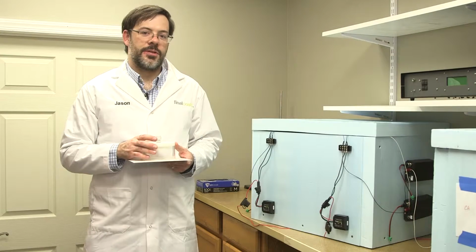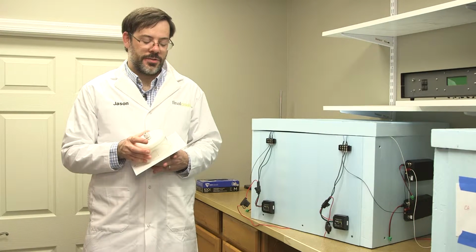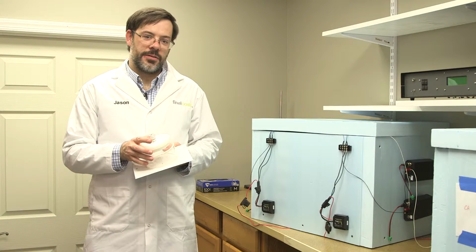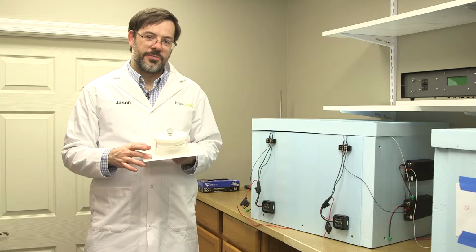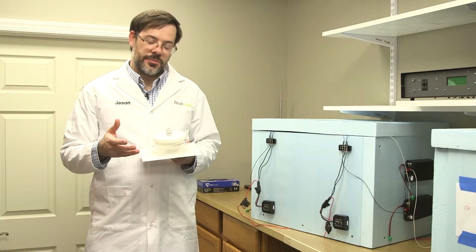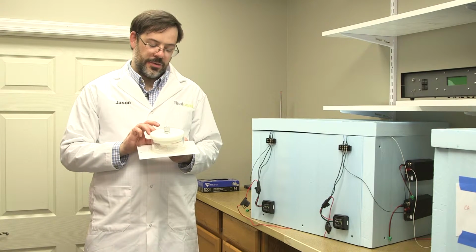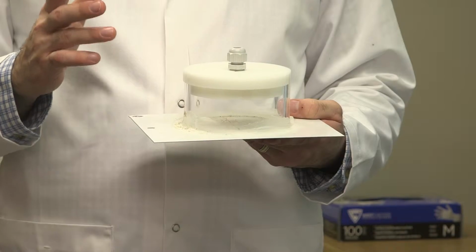These experiments are designed to complement the experiments in the Q lab chambers. And as you can see here, the sample is different. The specimen itself is still galvanized steel, but instead of being exposed to a fog, it's exposed to a volume of electrolyte that's contained in this acrylic cylinder right here.